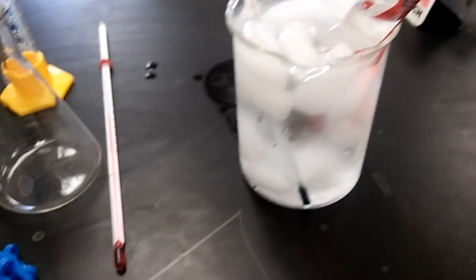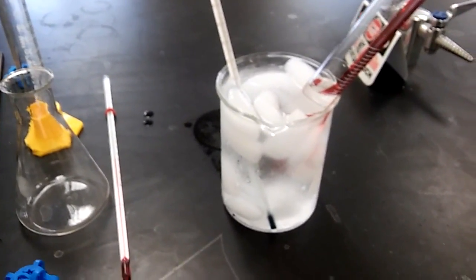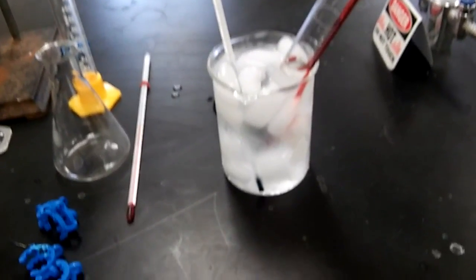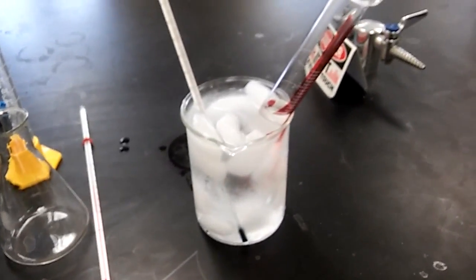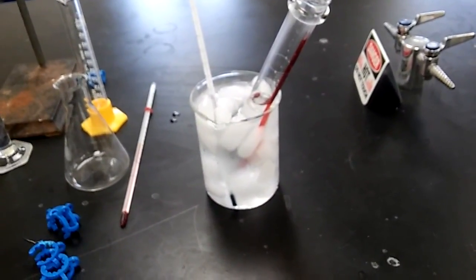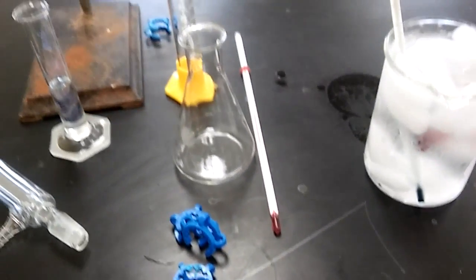And then I have an ice bath here, and I put some ice and water and put a measuring cylinder with 35 milliliters of hydrochloric acid, and it's been sitting there till the temperature of the bath got to about 5 degrees. It doesn't have to be super accurate. If you go a little bit lower, that's okay. The point here is you're trying to keep the hydrochloric acid a little bit colder when you mix it with the t-butanol. And I got some clamps, a thermometer.